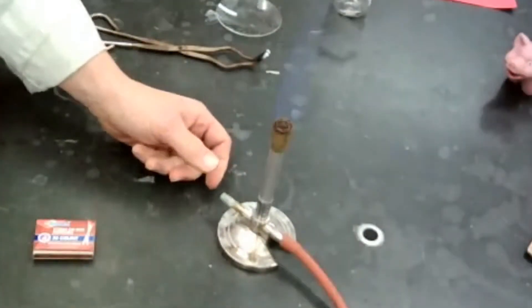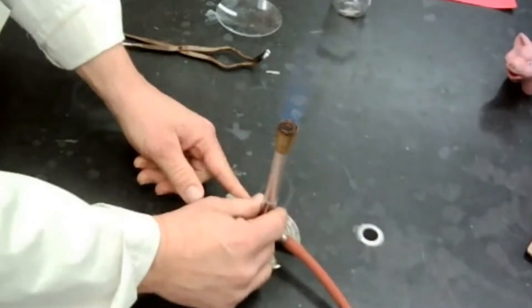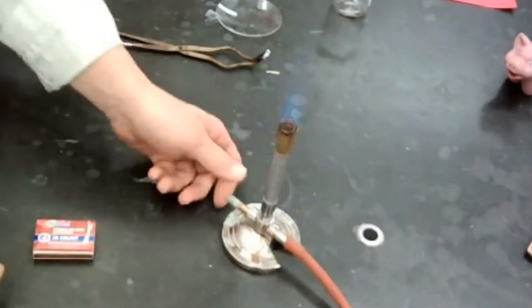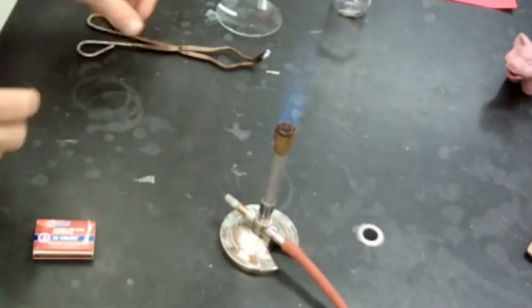I'm not throwing that in the sink, I'm just putting it on the counter. And I've got my Bunsen burner going. I'm going to adjust my flame. That looks pretty good. Maybe a little bit more gas. That looks fantastic to me.